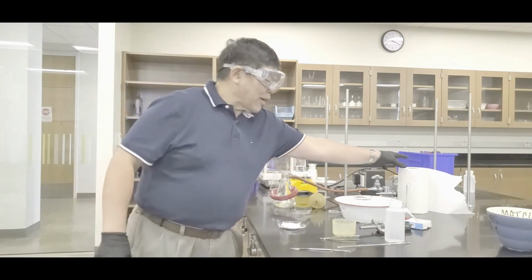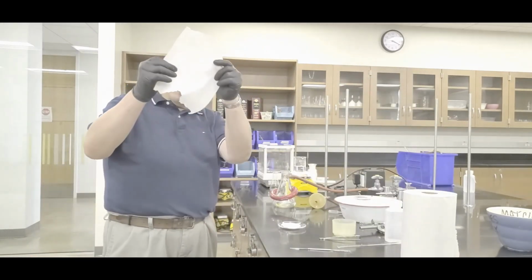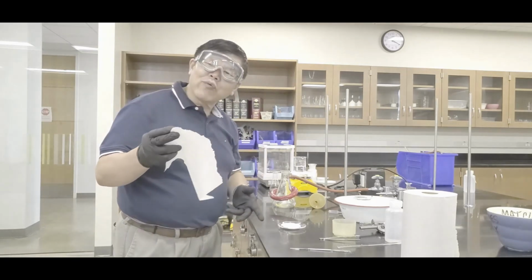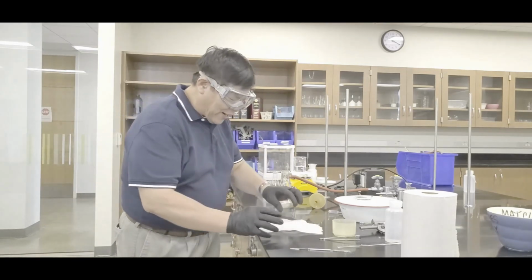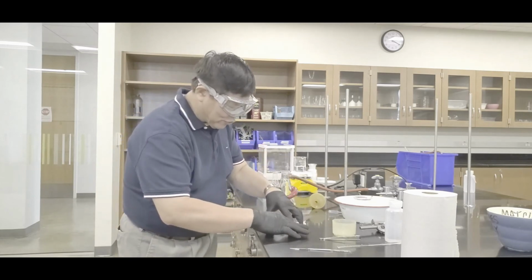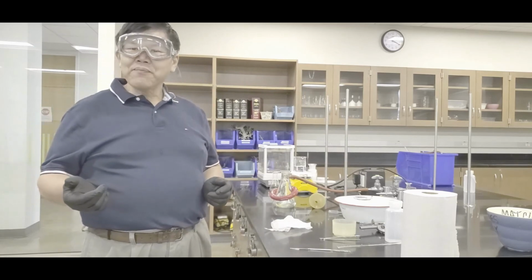Now before you go home that time, what you do is this, paper like this, and you want it loosely covered. You don't want this thing touching, okay? So sort of like that, yeah, put your name on the paper, yeah? And then we'll store it, and then we're done for the first week, yeah?